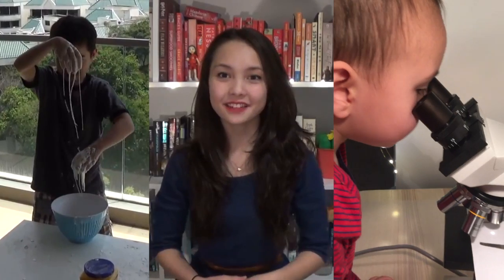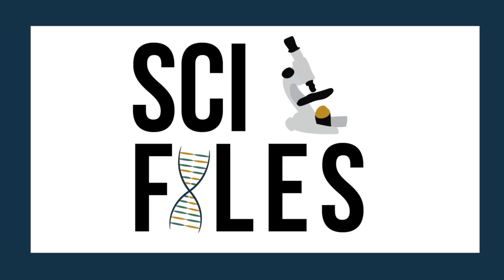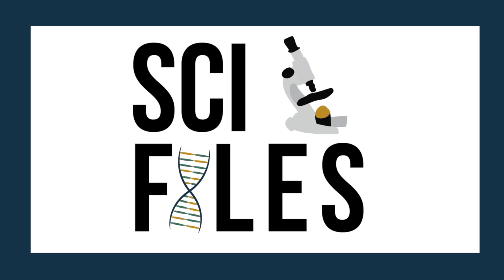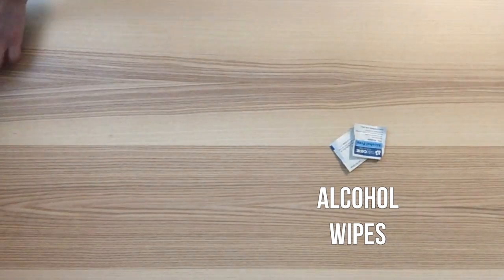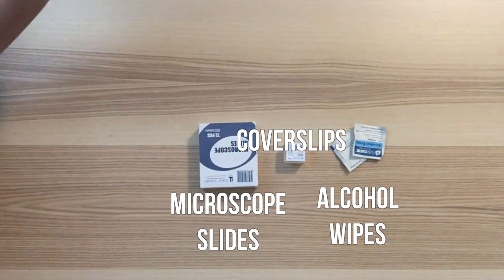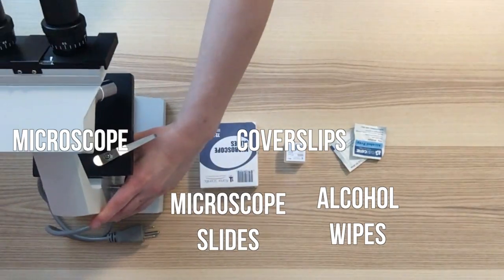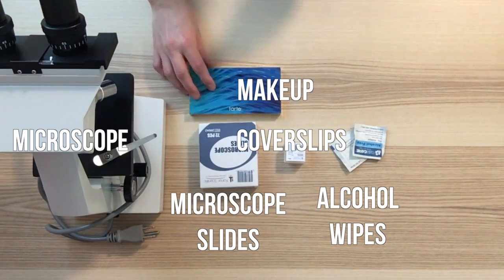Today, we're going to be putting some makeup under the microscope. For this experiment, you will need alcohol wipes, cover slips, microscope slides, a microscope, and makeup.